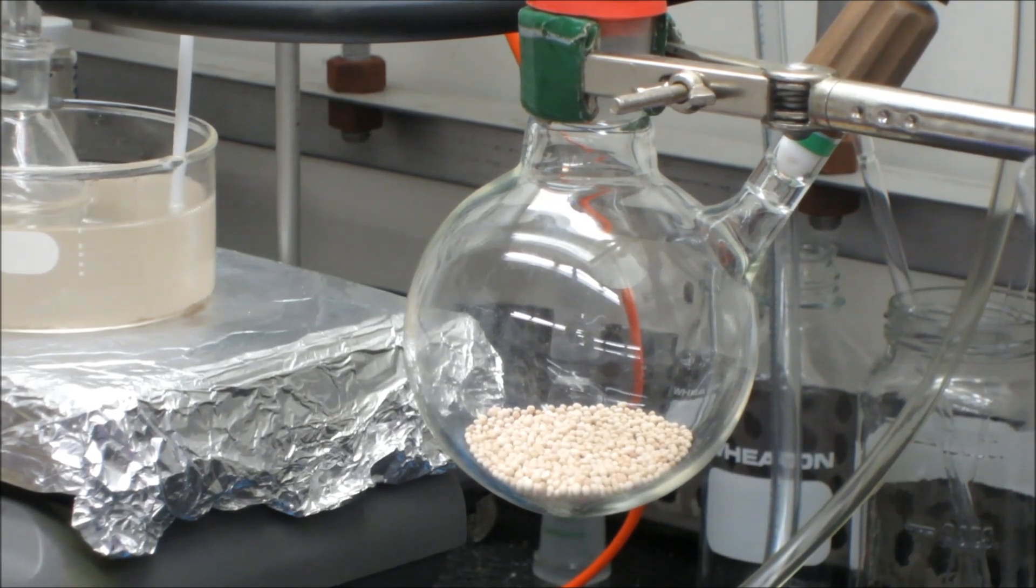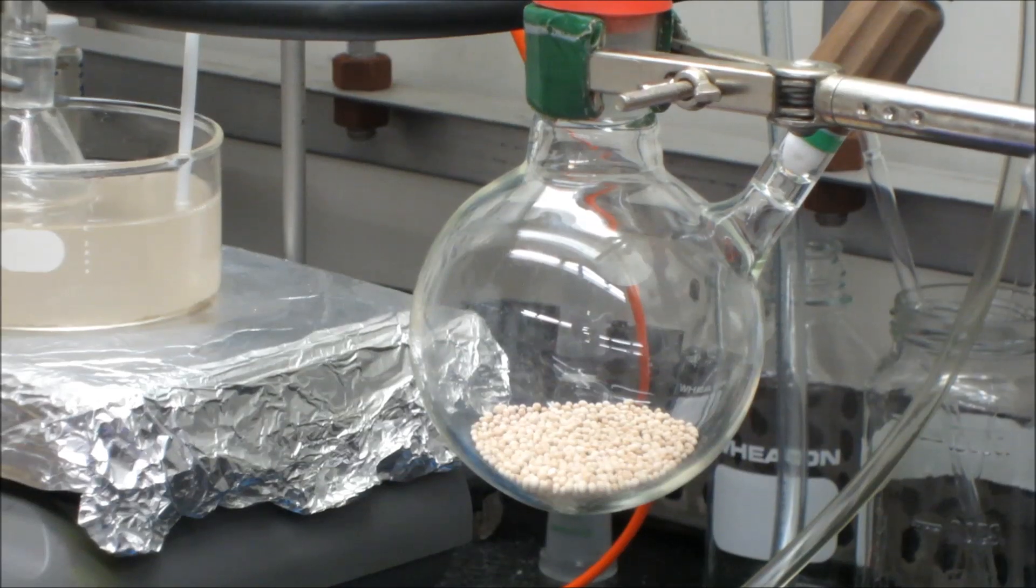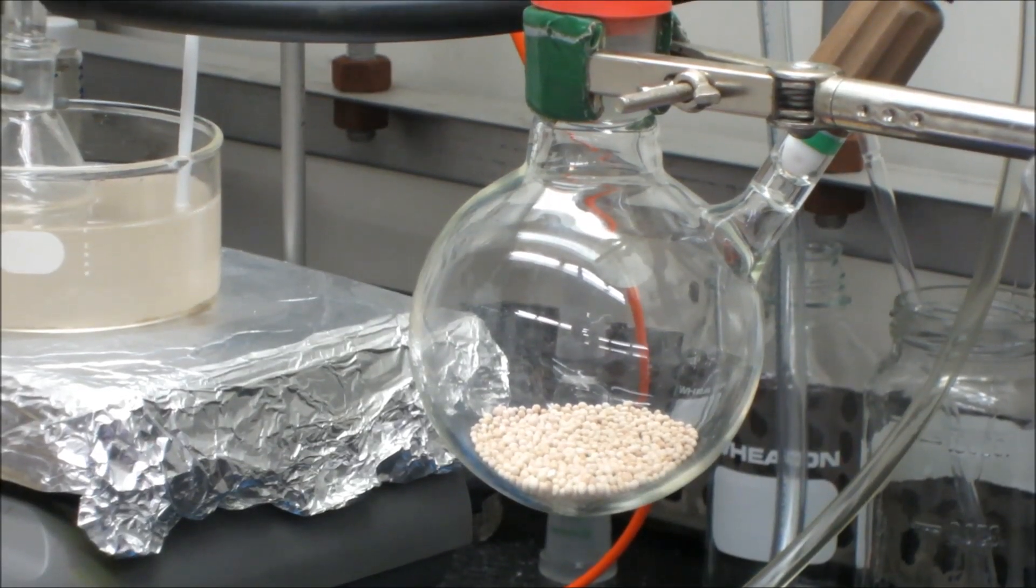And so after a few cycles of this, the sieves will be ready for whatever solvent you would like to keep dry. Thank you, Dan.